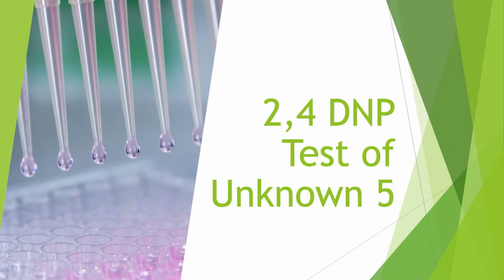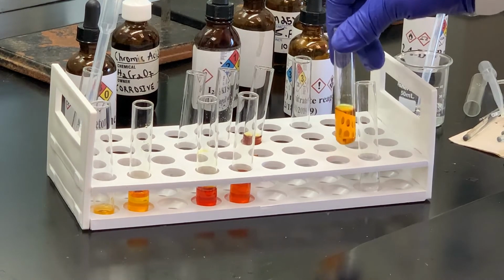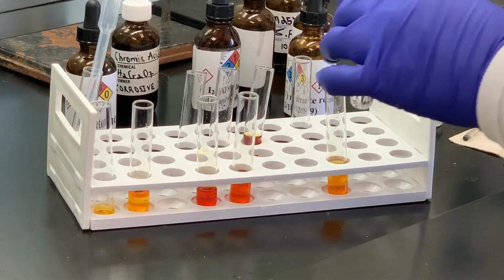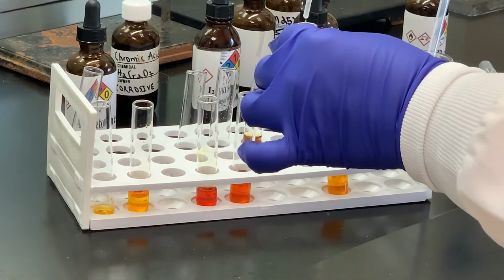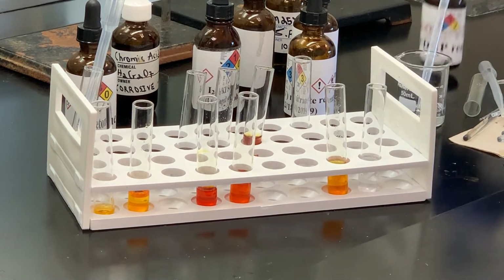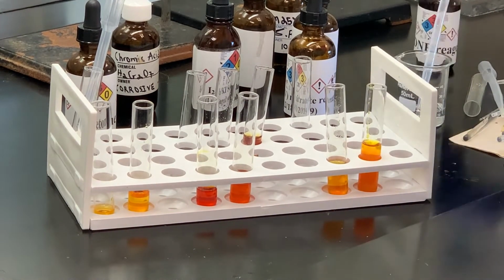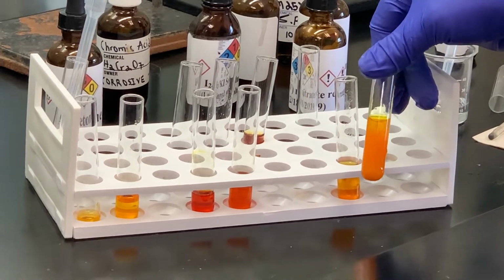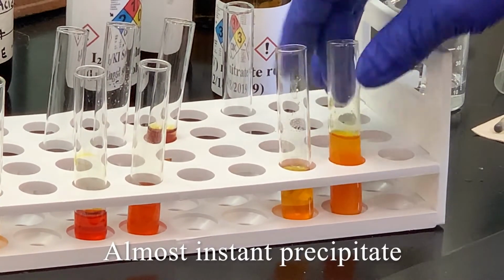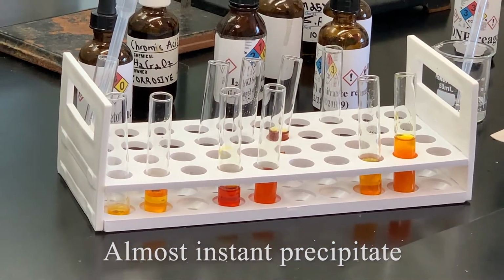Our next one is the 2,4-DNP. This is our control, the standard, with nothing in it except ethanol and the 2,4-DNP reagent. I have ethanol here. I'm going to add some of our unknown to it. Again, swirl to mix, and then I'm going to add some 2,4-DNP to that. We'll see what happens. If you notice, we formed a precipitate. What does that tell you? That was pretty much instantaneous. What does the 2,4-DNP pick up? Carbonyl groups of aldehydes and ketones.